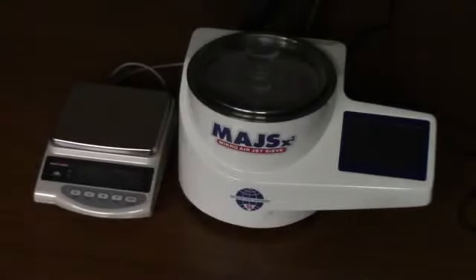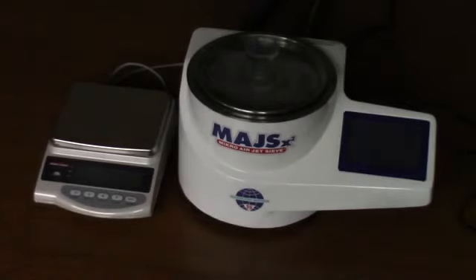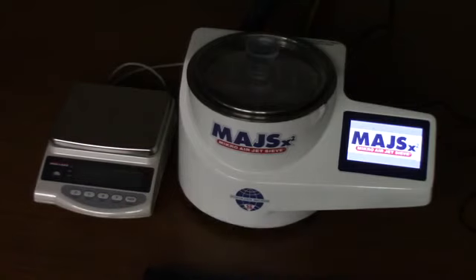Today we're going to talk about starting up your Mikro Air Jet Sieve Model X2 for the first time. Turn the power on. The software will go through its startup sequence. As it does, you'll see various screens that give you an indication the software is properly loading. We have already connected a mouse, which is completely permissible, and we have connected an external keyboard. The external keyboard, however, takes precedence over the internal software keyboard.